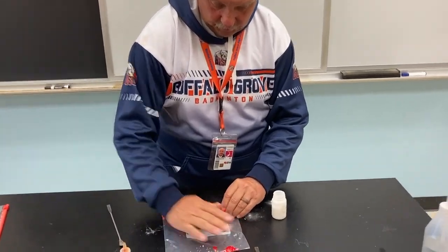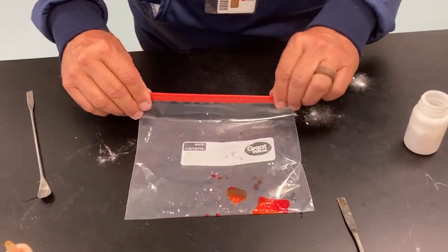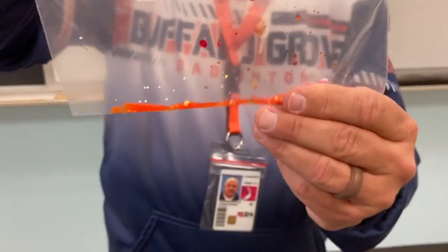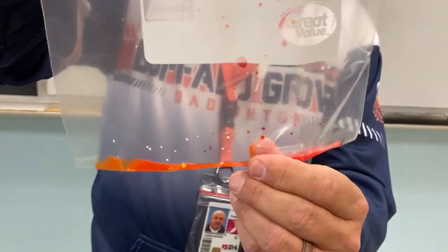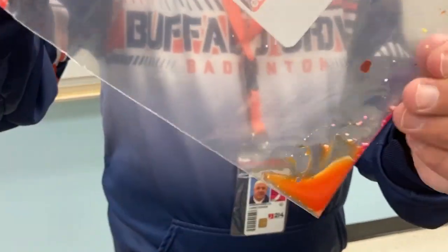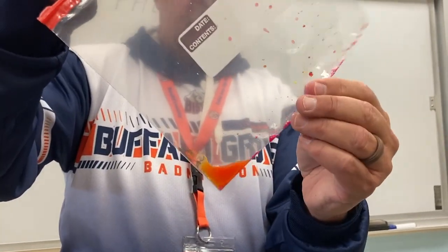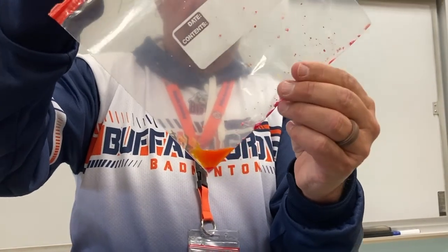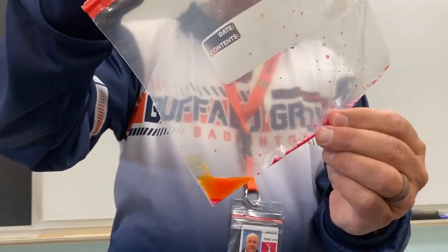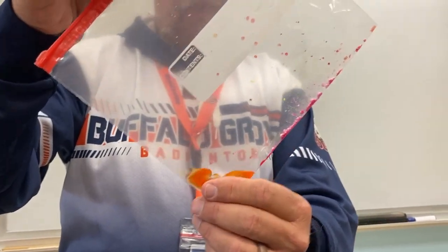Oh. Ooh. Okay. In looking at this, you can see on this side we're certainly getting a color change. But it's not going to the yellow. It looks like it's maybe a reddish orange. So there is a slight color change, but that's not the color change we saw before. No. So we're not going to count that as a color change in our observations. We're looking for a yellow color, and that's not a yellow color.